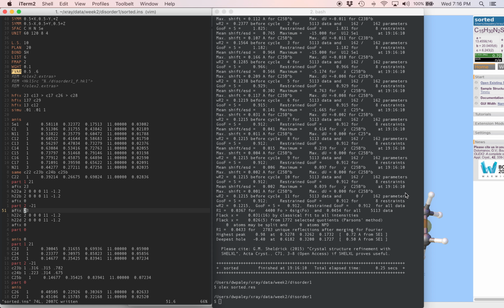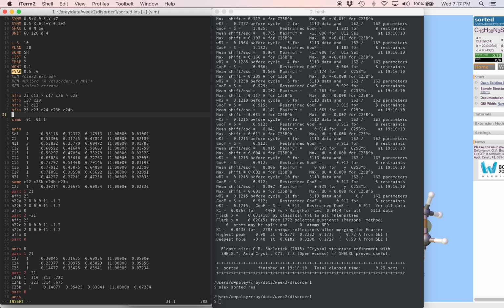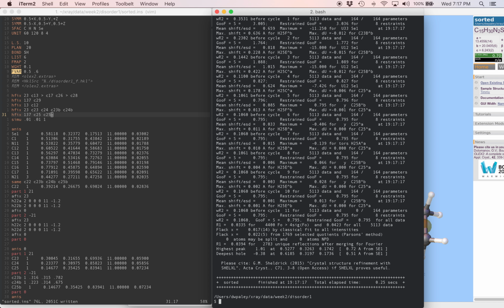Let's come back here and HFIX the rest of the disordered hydrogen atoms. I'm just going to write new HFIX instructions. HFIX 23, this is going to be C23, C24, and C23B, C24B. The two methyl groups, it's HFIX 137, and those are C25 and C25B. Run that refinement again. Now the R factor is down to 3.9%.